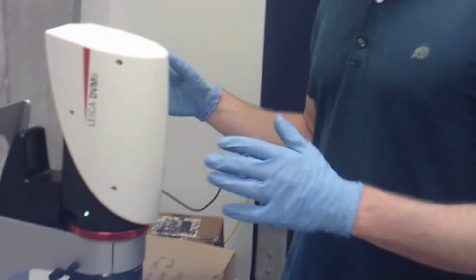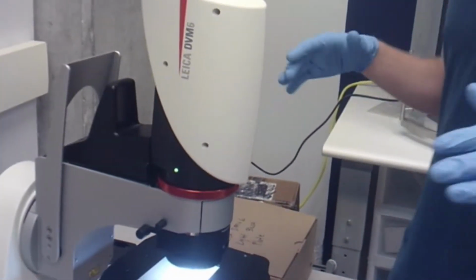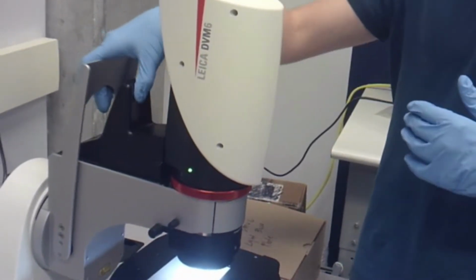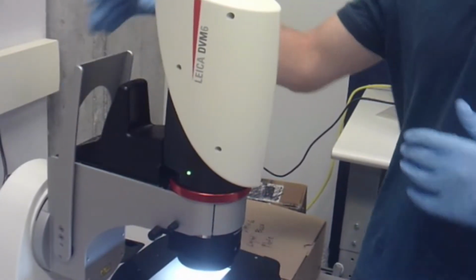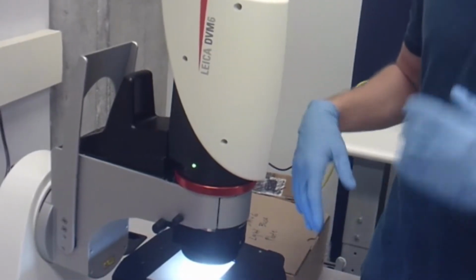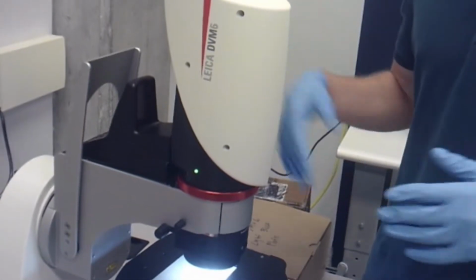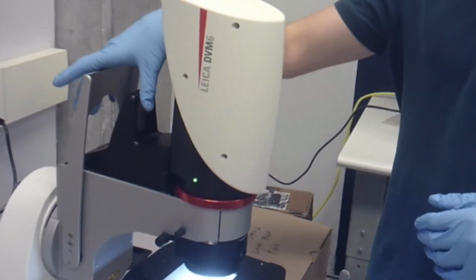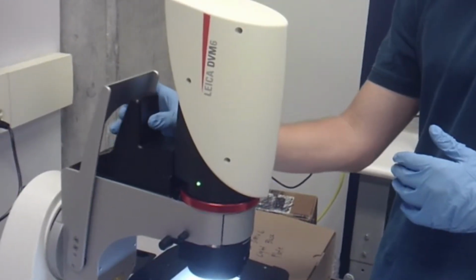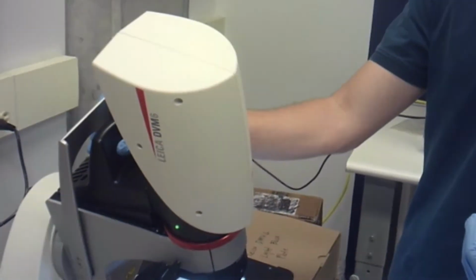You can rotate the head of this, it's pretty easy, but please note that you do not want to rotate this under any circumstances without pushing forward this metal knob in the back here. If you do not do this and just go and push the top of the microscope, you run the risk of dislodging it and breaking the microscope, which would be a very expensive mistake, so please do not do that. But to rotate the microscope, it's actually really quite simple. Just take this metal handle in the back, push it forward towards the front of the microscope, and you have freedom of rotation of about 30 degrees.